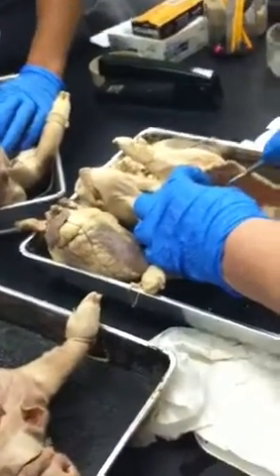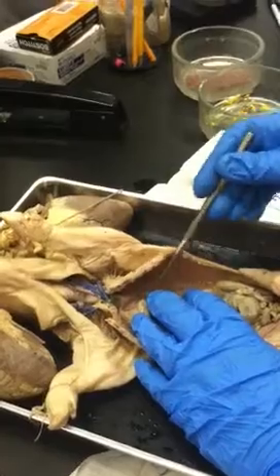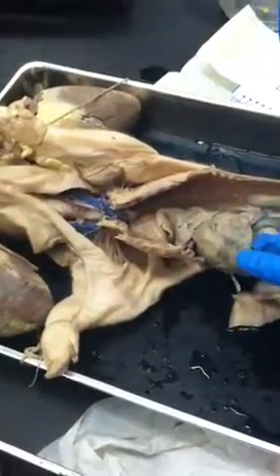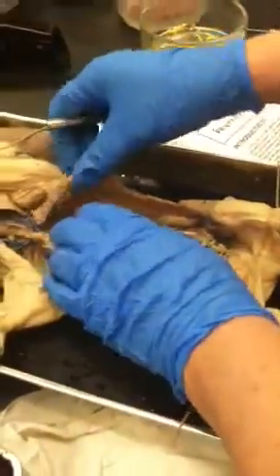So you have the dorsal aorta. If you pull that, you can see it coming down. You have the thoracic, and then as it moves into the abdominal cavity, the abdominal aorta. So thoracic aorta, abdominal aorta. The arch is where those vessels are extending off.